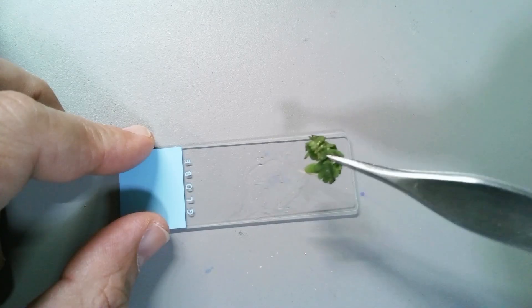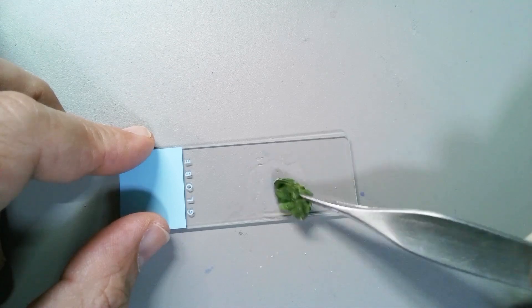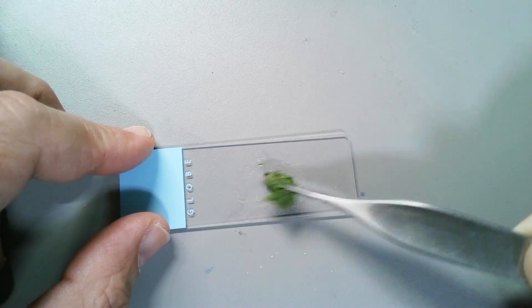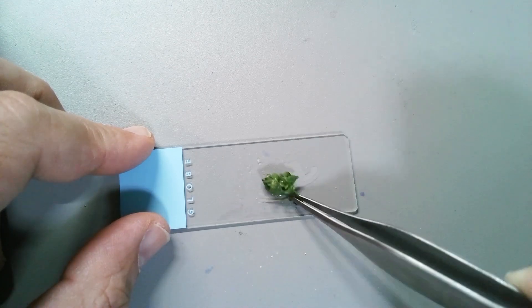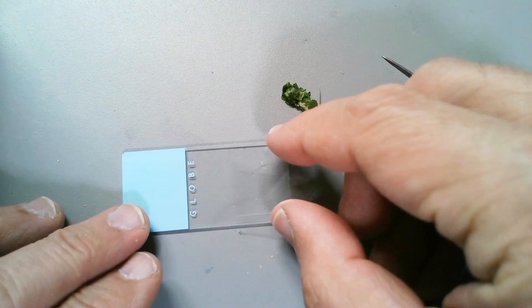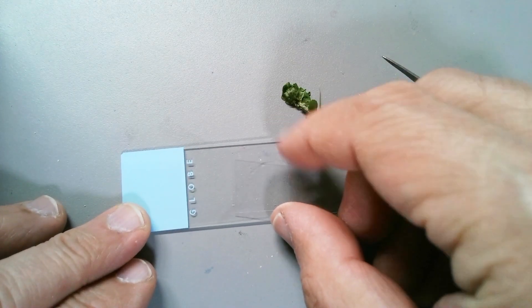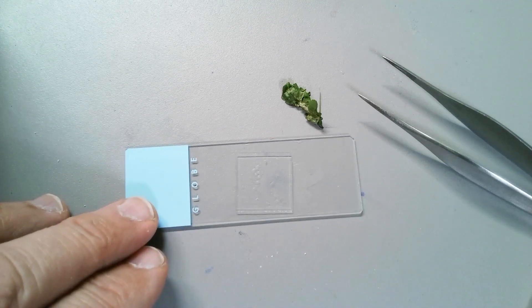Basically a fern, when you put it under the microscope - this is what I have done. I've taken a small leaf from the fern and tapped the leaf at home on a microscope slide with a little bit of water to wash out the spores. Ferns actually reproduce by spores, but not only.